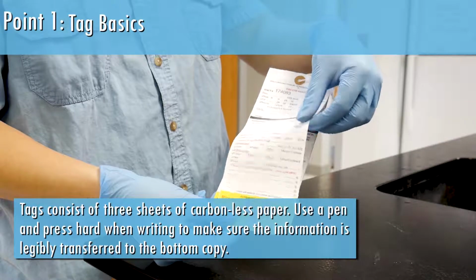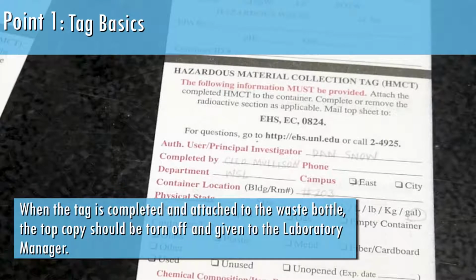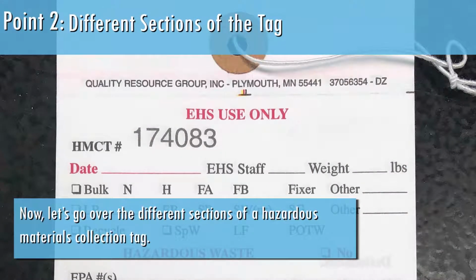Tags consist of 3 sheets of carbonless paper. Use a pen and press hard when writing to make sure the information is legibly transferred to the bottom copy. When the tag is completed and attached to the waste bottle, the top copy should be torn off and given to the laboratory manager. Now let's go over the different sections of a Hazardous Materials Collection Tag.